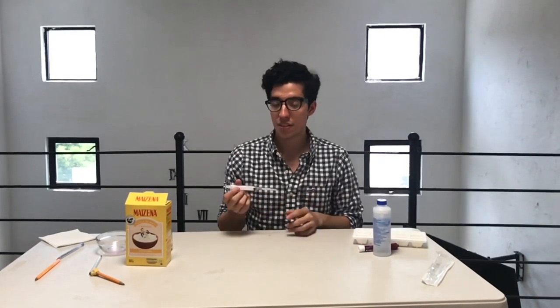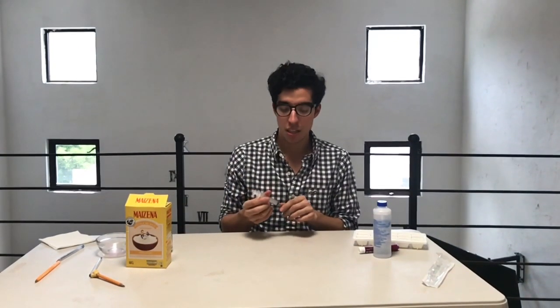It is necessary that you understand the parts of the experiment. We should remember that the parts of the fundament work pretty well if you choose them well. Before starting the experiment, I will try to explain why we use this material. First of all, we had the syringe. The syringe is going to be our column. We just remove the needle because we won't use it.